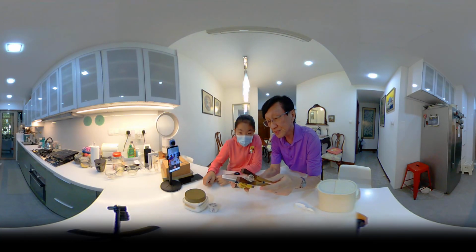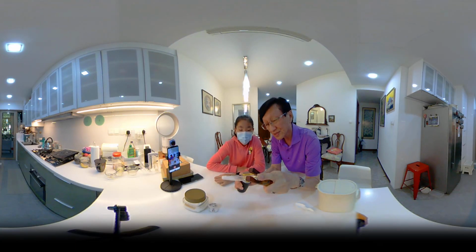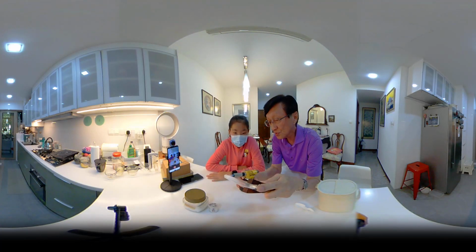Can you see that one of them is going to sublime, and fumes are going to come out? Can you see the white fumes? Yes or no? Yeah. Now that white fume is actually ammonium chloride trying to sublime, and then when it sublimes, it turns into two gases.